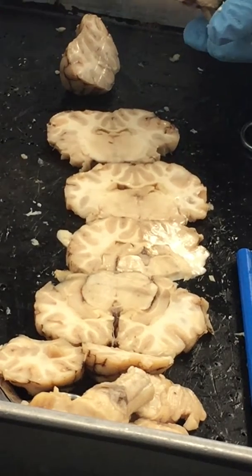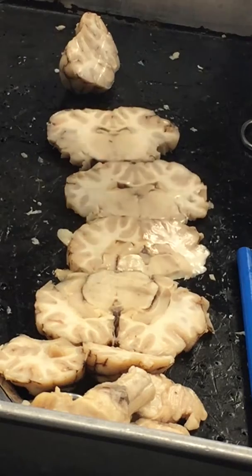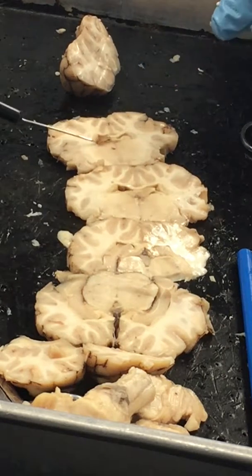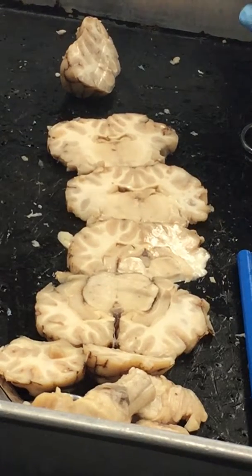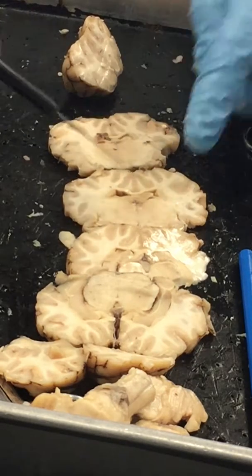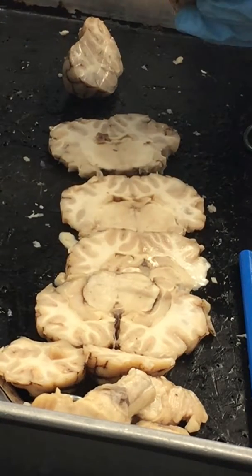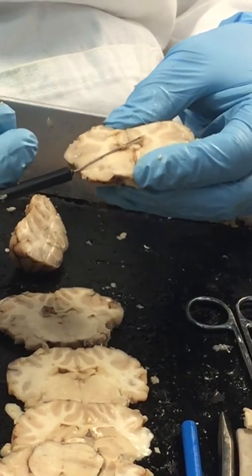Now, our ventricles are filled with the choroid plexus. Choroid plexus are these clusters of blood vessels. So if I look in here, believe it or not, you see all this that I just pulled out? That is the choroid plexus. This is part of that choroid there. Now it's on my pointer, but it's going to be in all of these ventricles. If I give you that back, you're going to see it. It's kind of all the way throughout, because that choroid is everywhere, producing that cerebral spinal fluid. See, I can pull it out here. You got it on both sides.